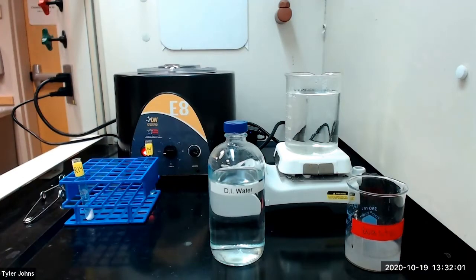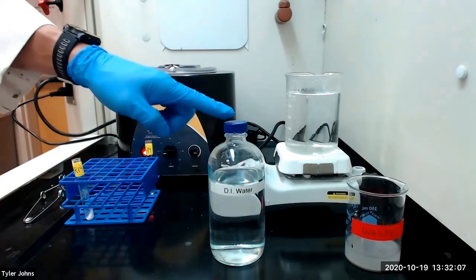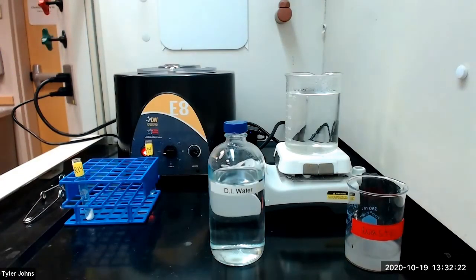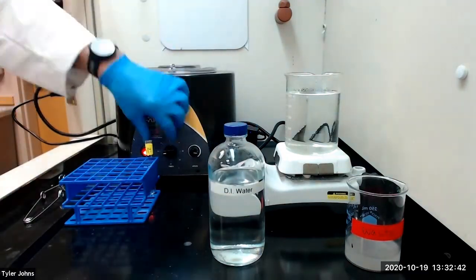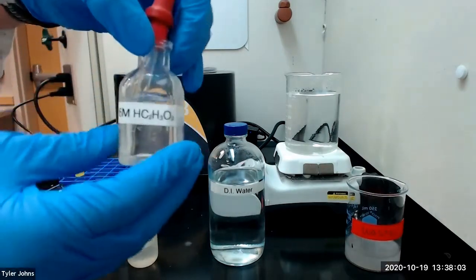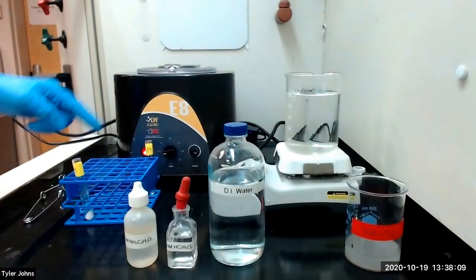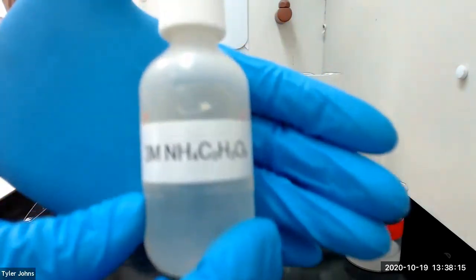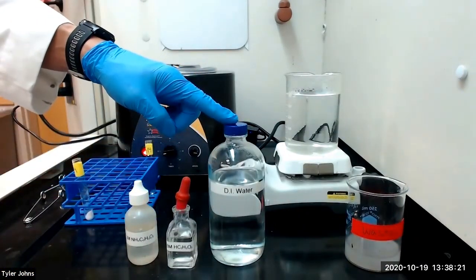We will now perform the test for barium ion. We will begin by washing residue R14 with one milliliter of deionized water, then centrifuging and discarding the wash liquid. We will next add five drops of six molar acetic acid to our residue R14 and warm in a hot water bath to dissolve the carbonates. We will then add five drops of three molar ammonium acetate and dilute the solution to one milliliter with deionized water.